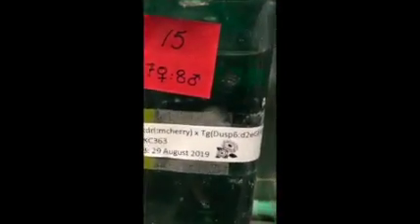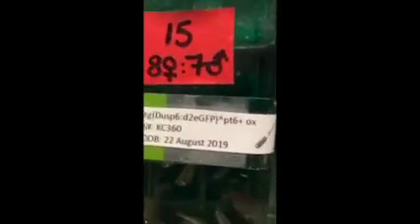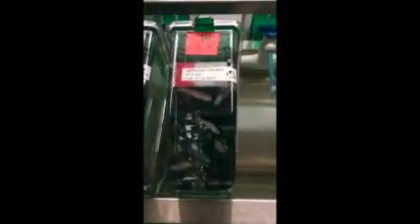These little tropical fish give us so many embryos each time we pair them that we can do many, many experiments at the genetic scale and at the cell biological scale. We have wild-type fish, over 15 different transgenic lines that allow us to see blood cells or parts of the nervous system that are responsive to different signaling pathways, or even that just outline cells within different parts of the nervous system.